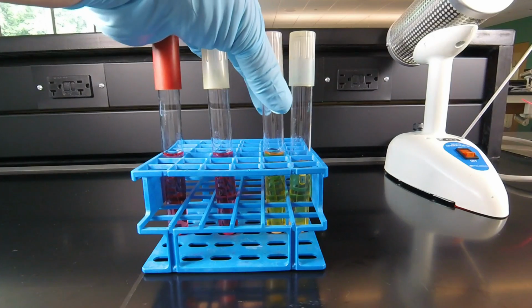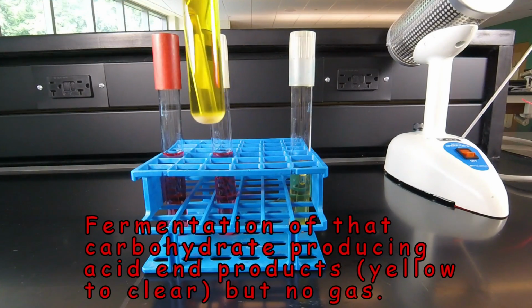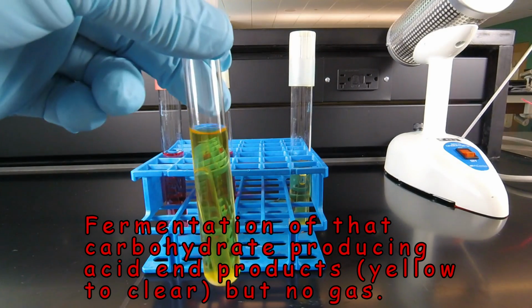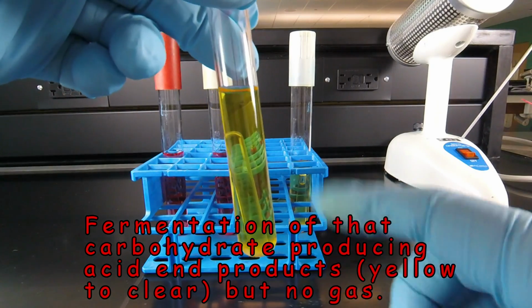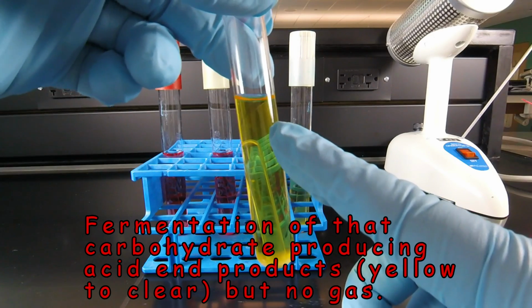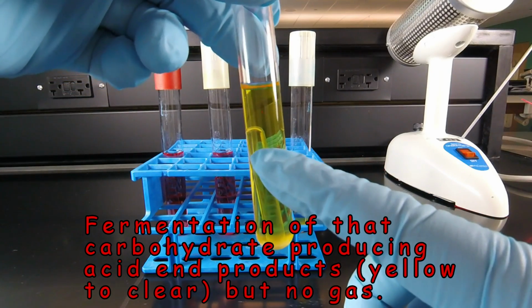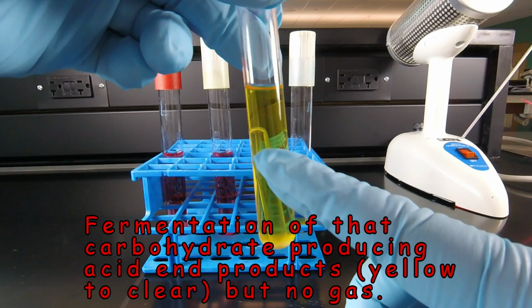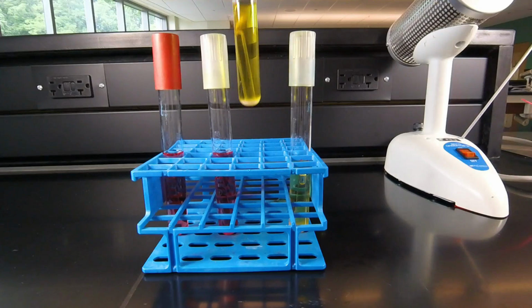In this tube, we see fermentation of lactose, the carbohydrate in the tube, with acid production, but no gas. So we see the Phenol Red has turned yellow, indicating acid, but there's no bubble in the inverted test tube or Durham tube. So that would be fermentation with acid and no gas.